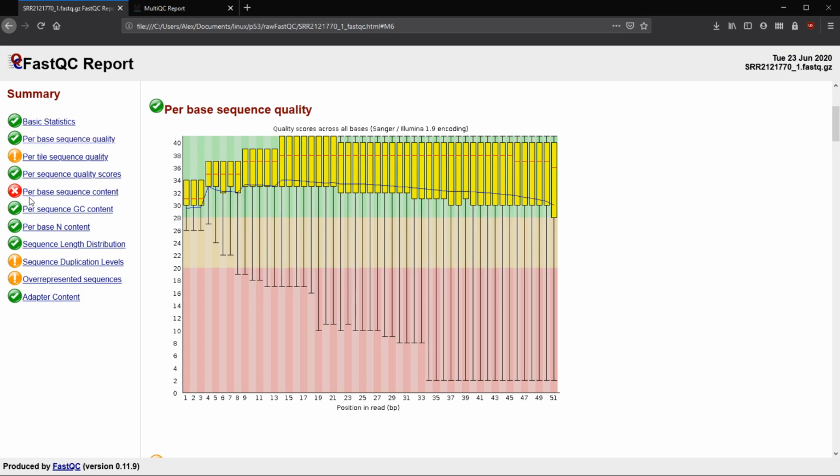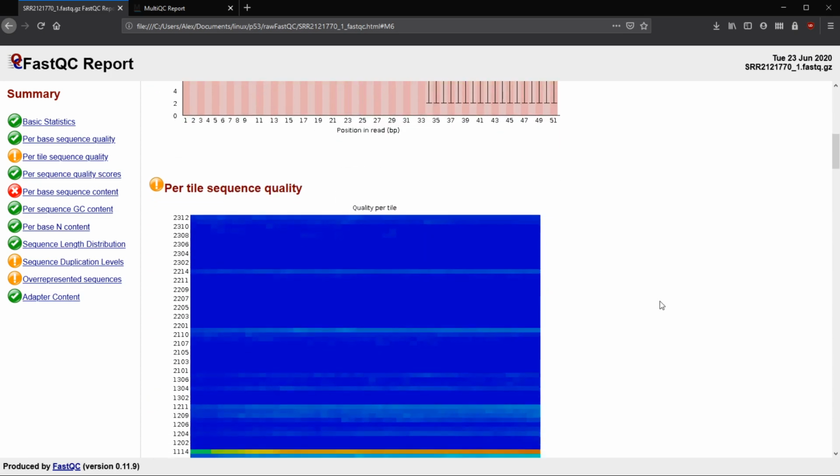A failure, so the red X, here will happen if this 25th percentile drops below 5, or if the median line, I should have said median, drops below 20. So if the orange line, not the blue, the orange line drops below 20, then we'll have a fail. So that's just something to keep in mind for the per base sequence quality.